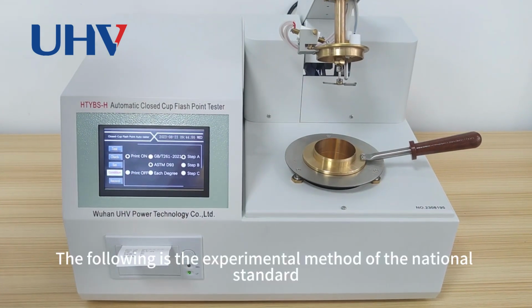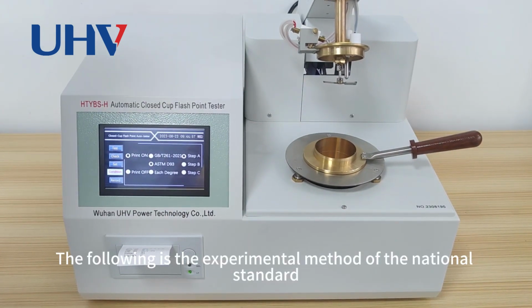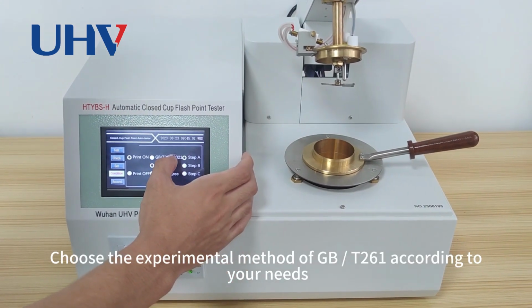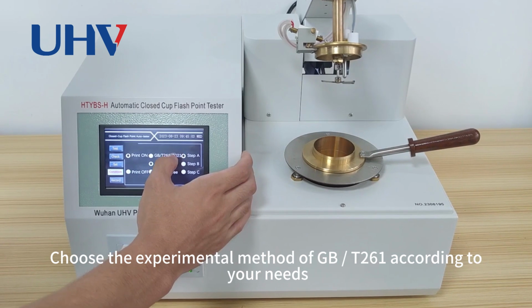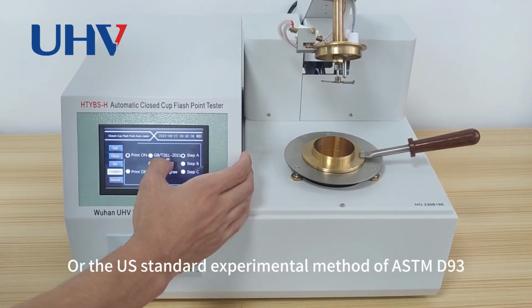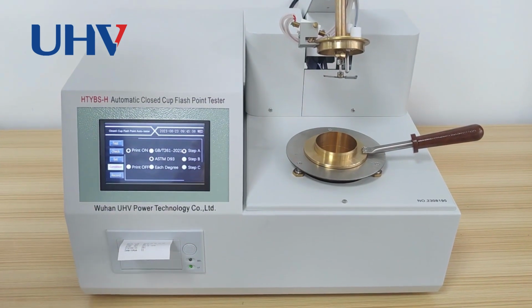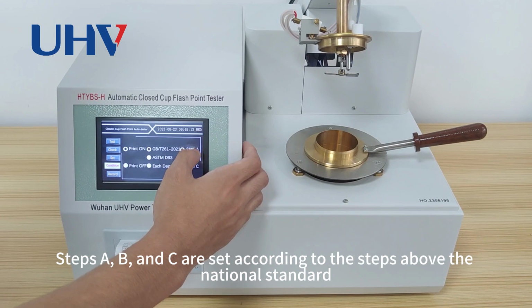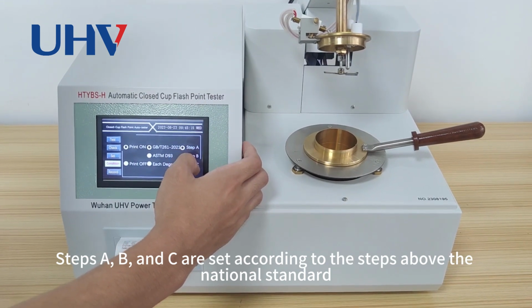The following is the experimental method of the national standard. Choose the experimental method of GB/T261 according to your needs, or the US standard experimental method of ASTM-D93. Steps A, B, and C are set according to the steps above the national standard.